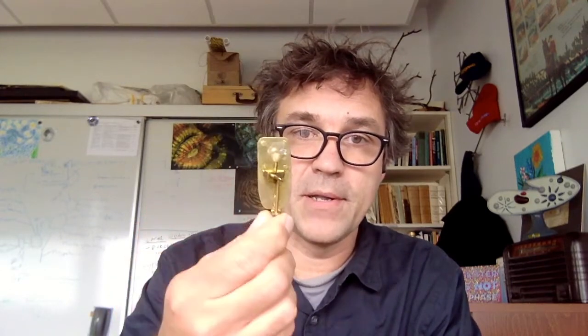Based on my interest in the history of microbiology, this is one of Leeuwenhoek's microscopes, which is quite a complicated little thing. And so as a teaching exercise, years ago, I worked out how you can make your own in the lab so that everyone in the class gets to make their own Leeuwenhoek microscope. It's made out of paper, and it's a lot simpler, but it works surprisingly well. And you get a bit of a sense of what microscopy might have looked like in the 1600s when Leeuwenhoek discovered the microbial world.